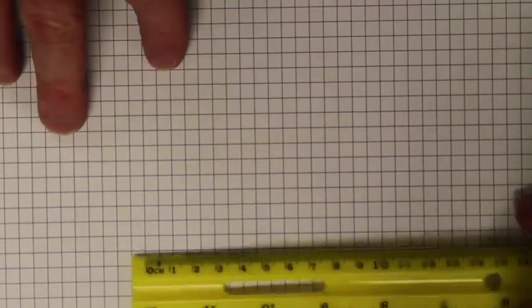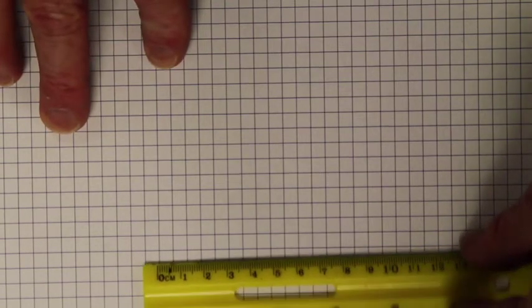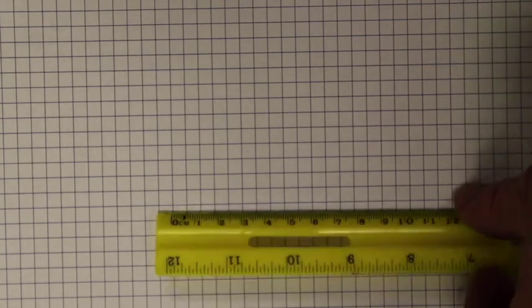So in order to calculate our distance moved, we're going to use graph paper. So here's a piece of graph paper. This is the graph paper we will use. It's important then to get the distance for each of these little squares. So if we go in, we can use this ruler here, get our ruler right on, and we can see that each square is approximately 0.5 centimeters. So we'll say each square is 5 millimeters. Okay.